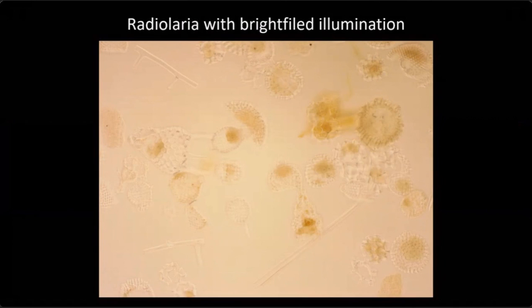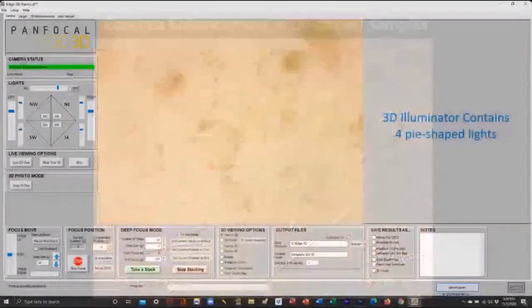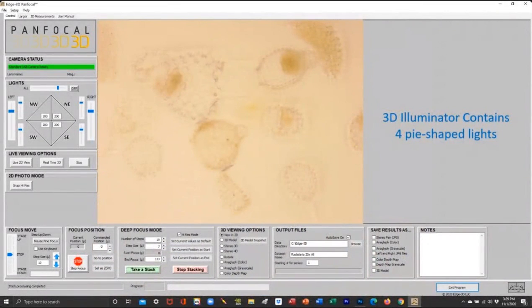But if you use oblique illumination with our oblique illuminator, that's that same image. Now you clearly see all the detail of this image with better depth of field, with great detail. Let me just look a little bit closer here. Now this is the graphic user interface. So look at the left-hand side where it says lights. So this system can be used just like a regular 2D microscope.